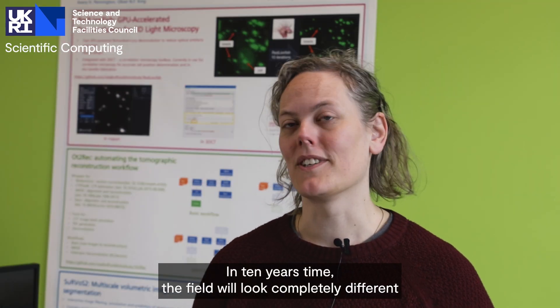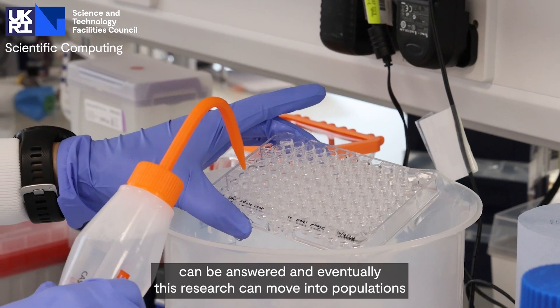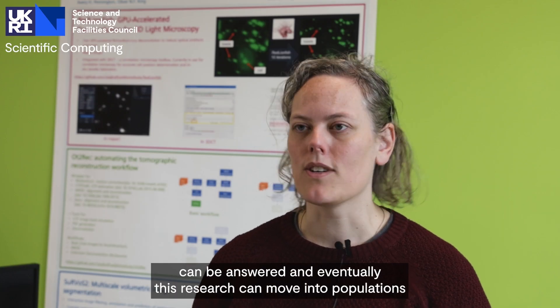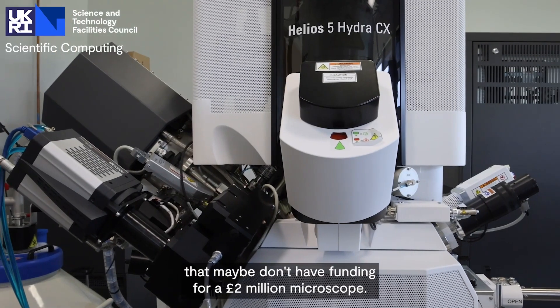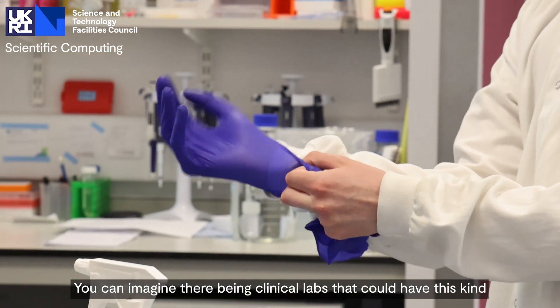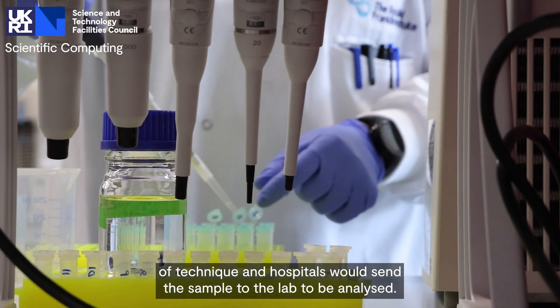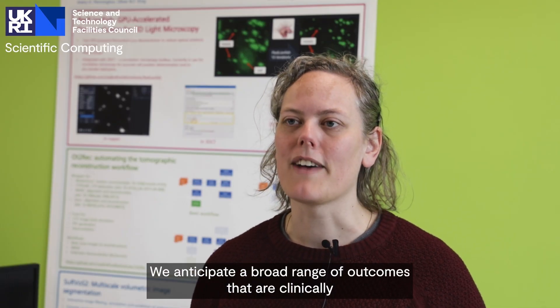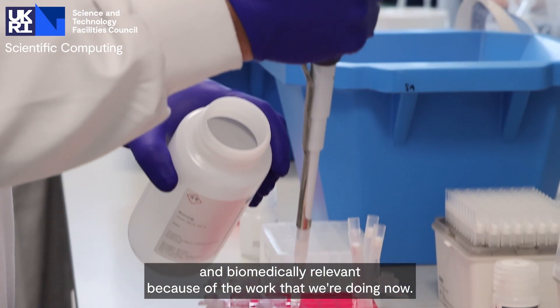In ten years' time, the field will look completely different, which means that more scientific questions can be answered, and eventually this research can move into populations that maybe don't have funding for a two-million-pound microscope. You can imagine there being clinical labs that could have this kind of technique, and hospitals would send the sample to the lab to be analyzed. We anticipate a broad range of outcomes that are clinically and biomedically relevant because of the work that we're doing now.